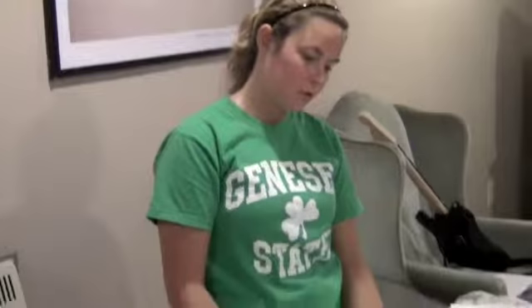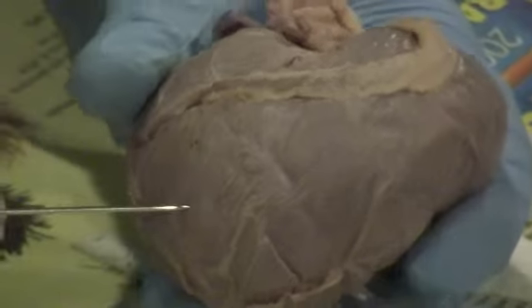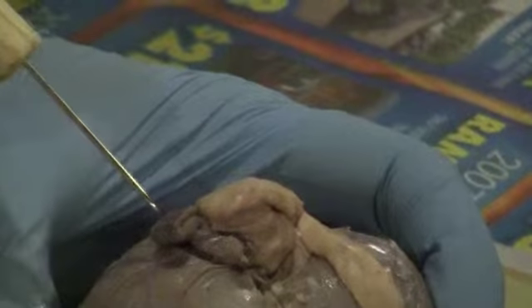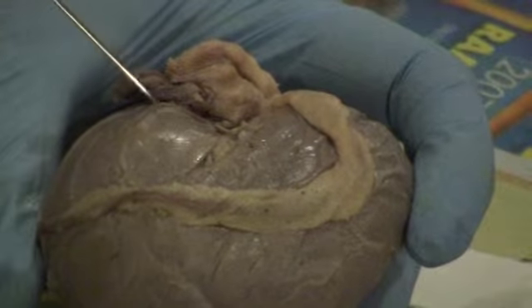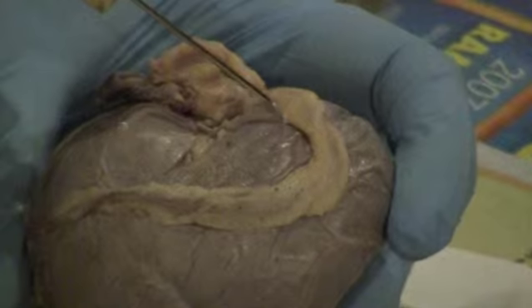This is the dissection of the sheep kidney, the external portion. The outer smooth transparent membrane that is attached to the surface of the kidney is called the renal capsule. The renal artery enters the kidney at the hilus, where the renal vein exits the kidney. And the ureter travels down the kidney. It is the largest of the three tubes, and it is where the urine exits the kidney and travels down into the bladder, where urine can temporarily be stored.